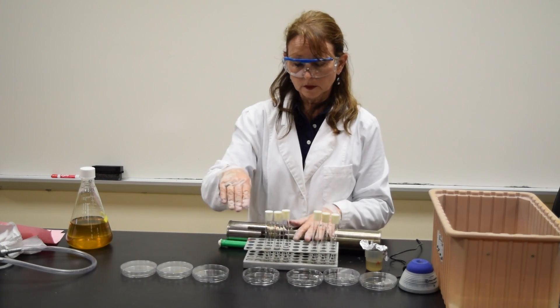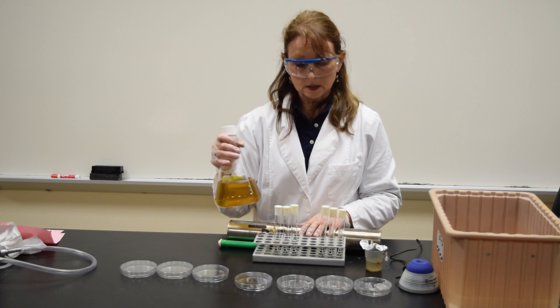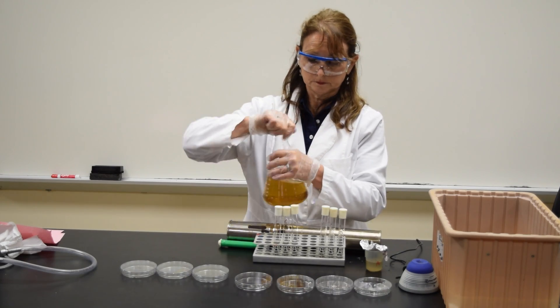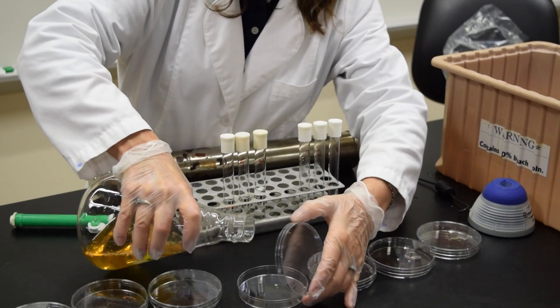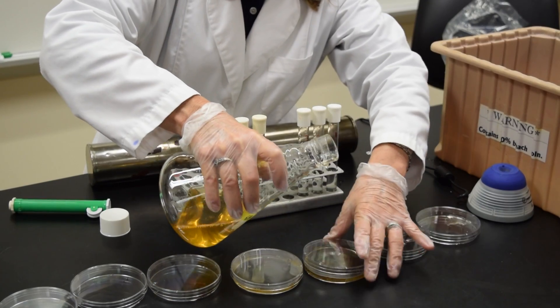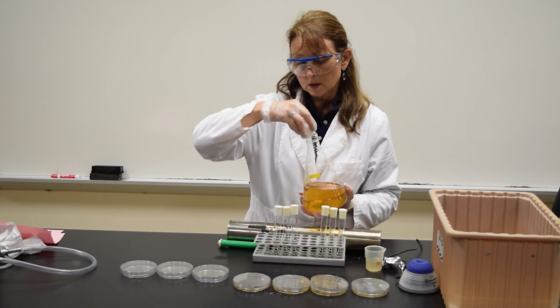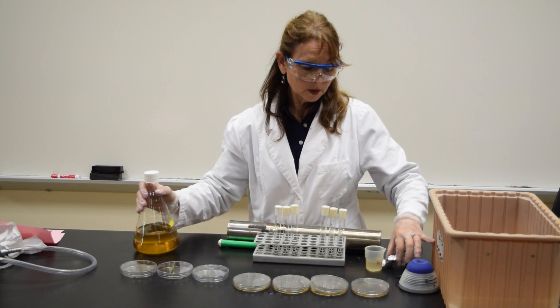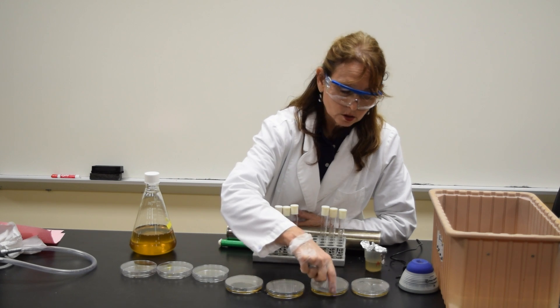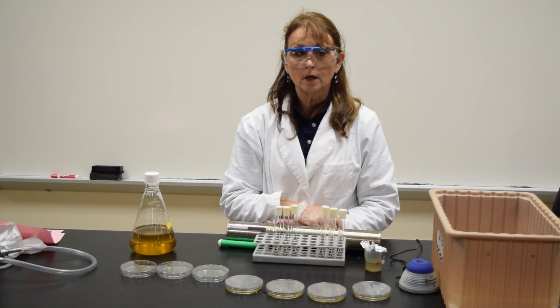Change the pipette. I would continue doing this for the next 3 plates. When I'm done, I now need to add my culture media to the plates. This is a pour plate method, which means you add your sample first, and then you add your culture media. Add the culture media to each of the plates, making sure the bottom of the plate is completely covered. You want to make sure that you thoroughly mix the plate — put two fingers on the lid and gently swirl each plate so that the organisms are evenly dispersed in the media. Allow the plates to solidify before you incubate.